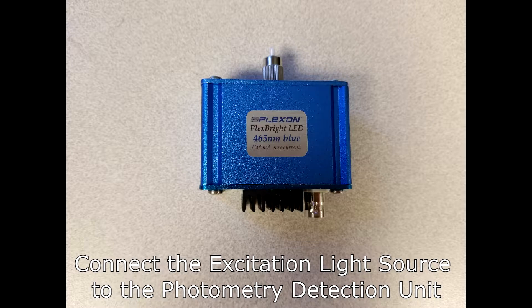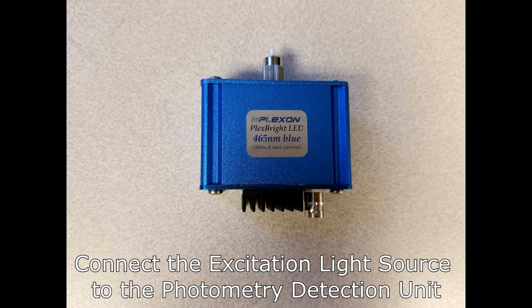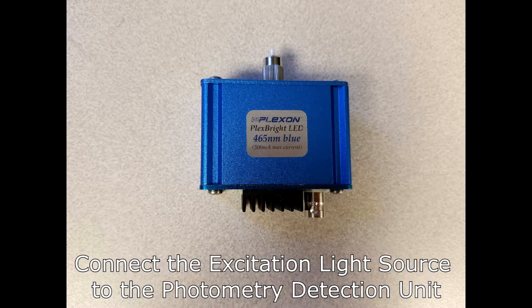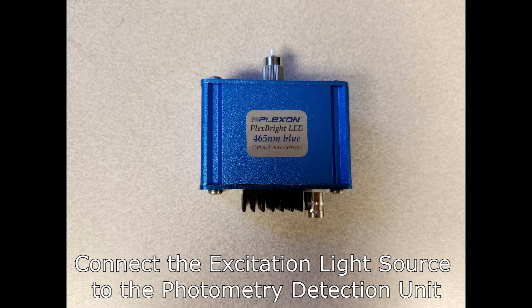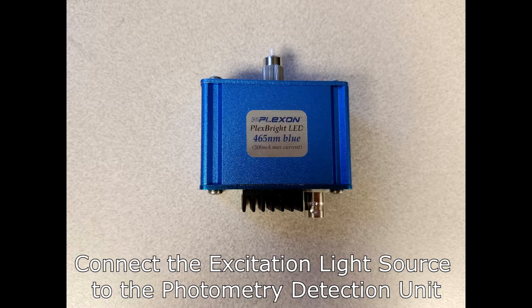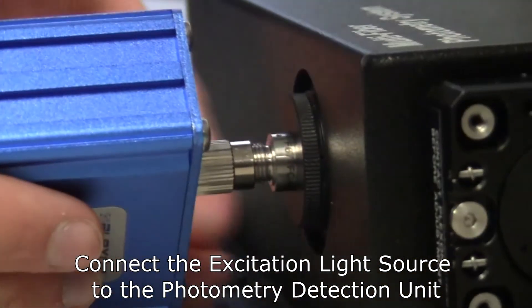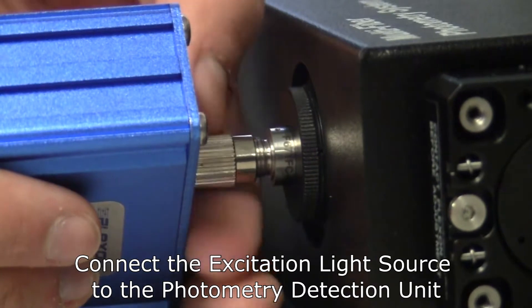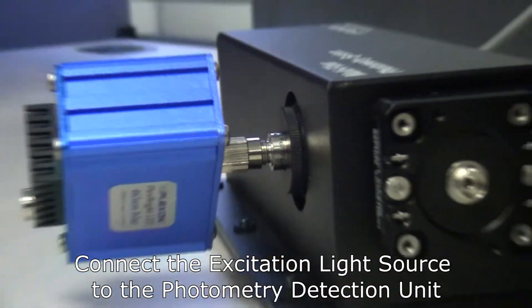Now, connect the excitation light source to the photometry detection unit. Note that there is a key on the male FC connector on the excitation light source that must fit into the corresponding slot on the female FC connector on the photometry detection unit. Make sure the key is aligned in the slot and then push the collar forward and screw it down to secure the connection.